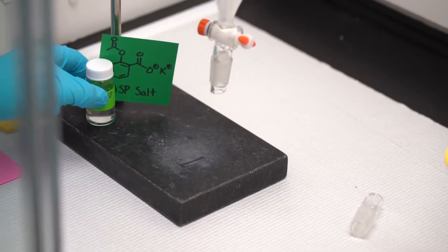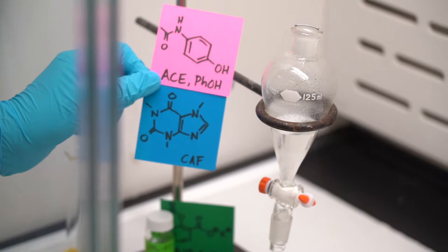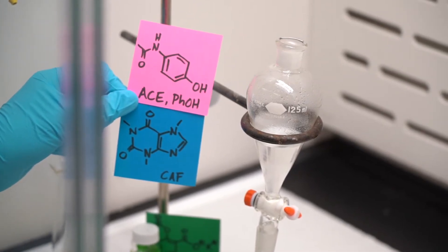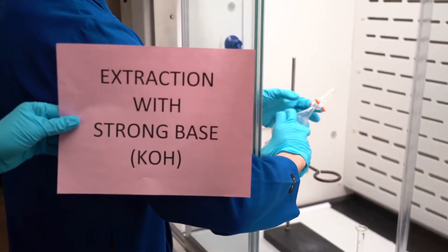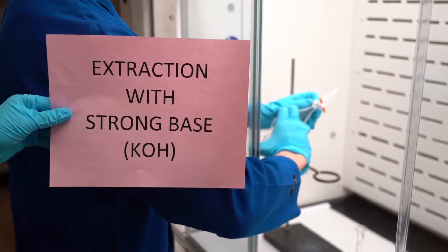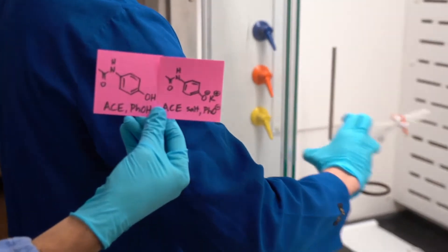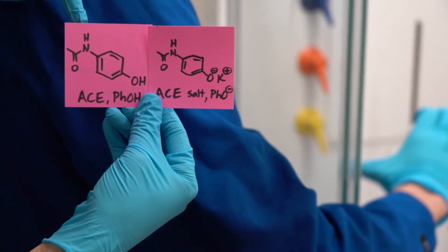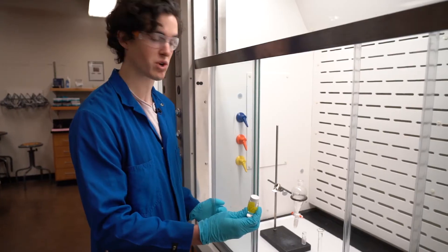Now that we've separated our aspirin salt into our aqueous phase, what remains in the organic layer is still acetaminophen and caffeine. The next step in our isolation of the Excedrin components is to isolate acetaminophen. We're going to use the same strategy we used to isolate aspirin, but in this case we're going to be deprotonating a phenol instead of a carboxylic acid. So we're going to step our game up and use a stronger base — potassium hydroxide.